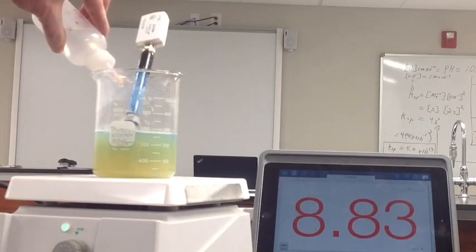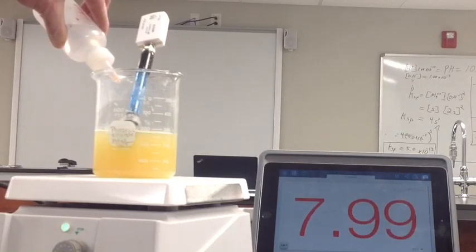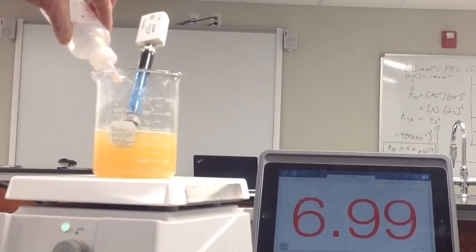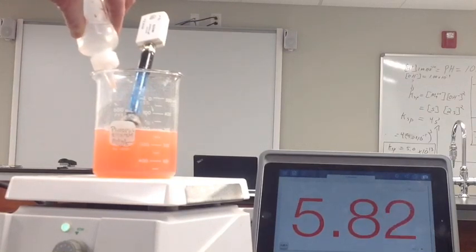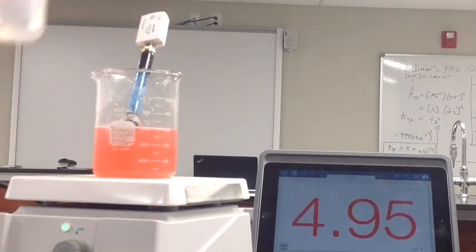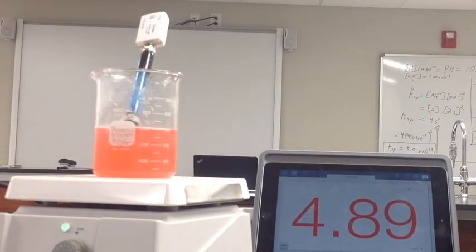Of course, at some point, all of that magnesium hydroxide is going to be ionized. And then we don't have a KSP situation anymore. Let's try and get to that point. See if that does it. Give it a moment. Well, I think at this point there is no more magnesium hydroxide solid in this solution.